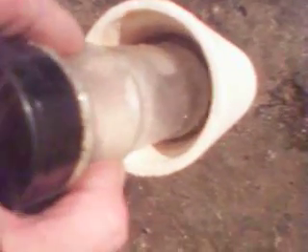That feels like it's pretty stationary — stationary enough that I can reach in there and grab it with my tongs. Pick it up. I'm looking at my crucible, making sure that it's all okay. I generally check on it better than I just did before I put all that in there. And of course, doing that and messing around with it caused the surface of this flux to unpack.